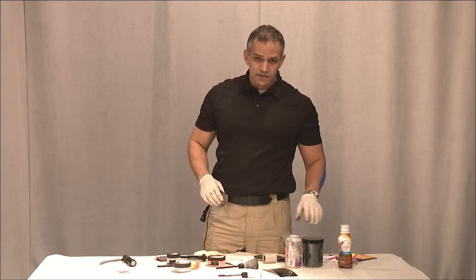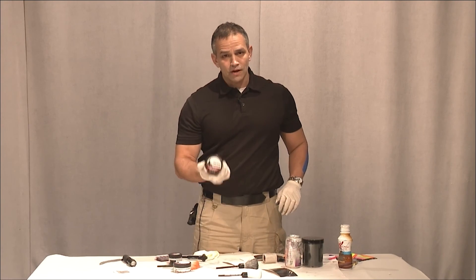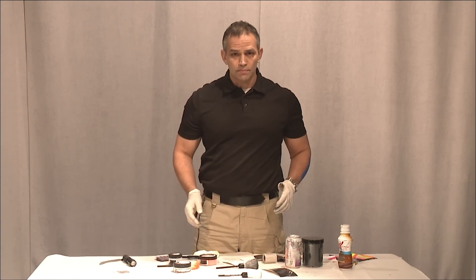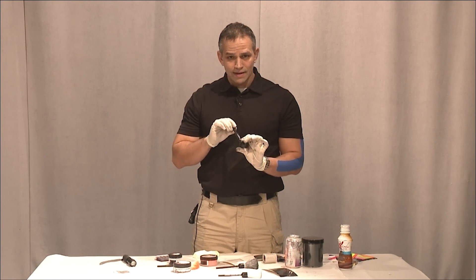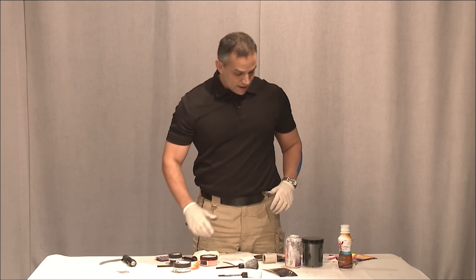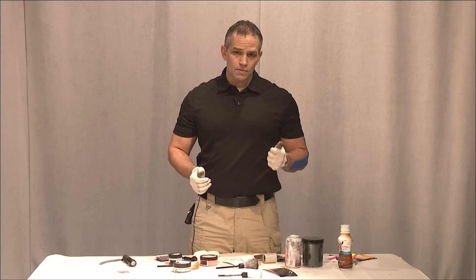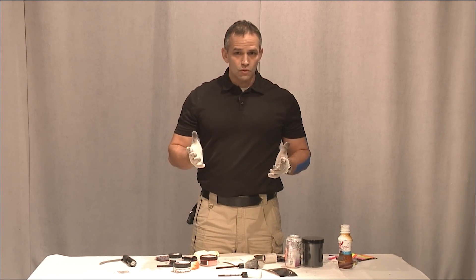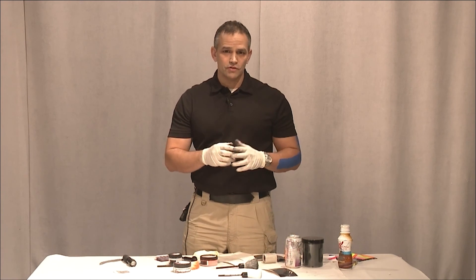So that's it — nice and simple today. We have our dual-use powder and we also have our fluorescent powder. Just make sure you use the appropriate brush. I do like the larger magnetic brush if you're going to be using the magnetic powder compared to the smaller ones. Watch all my videos on YouTube, on my website forensiceducation.net. And if you want, I can come to your department and show you how to use all this stuff. I'll talk to you soon.